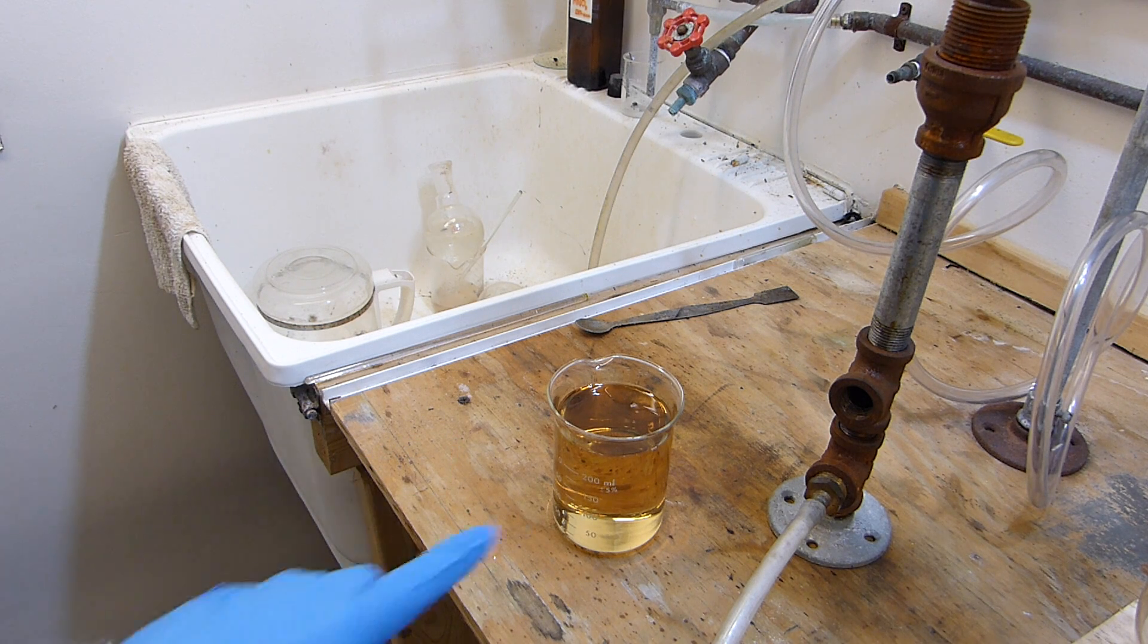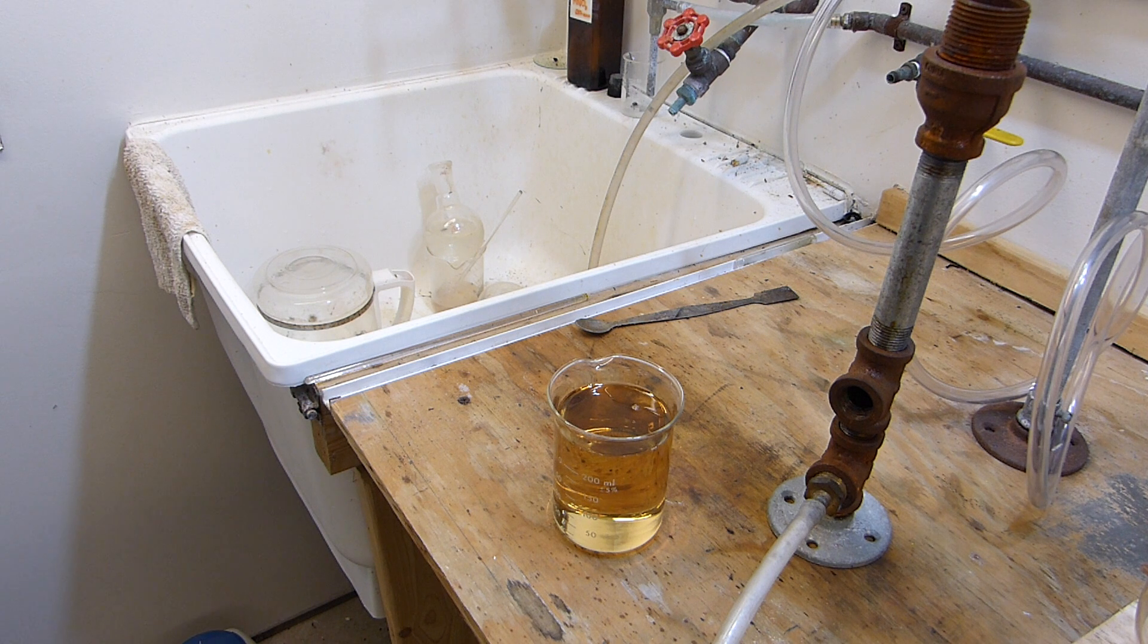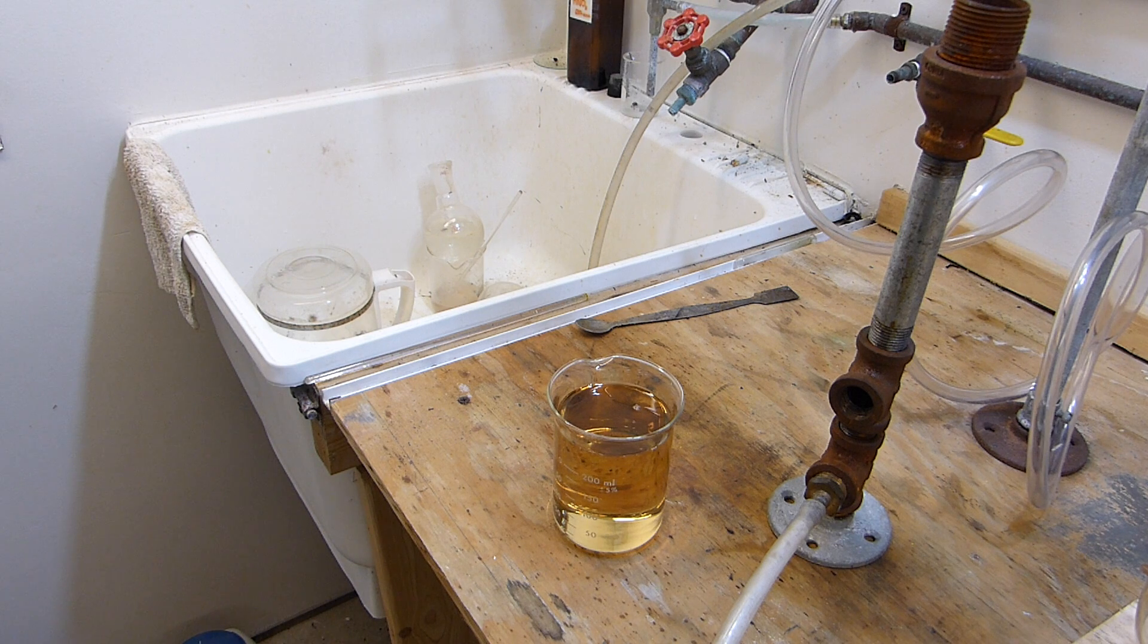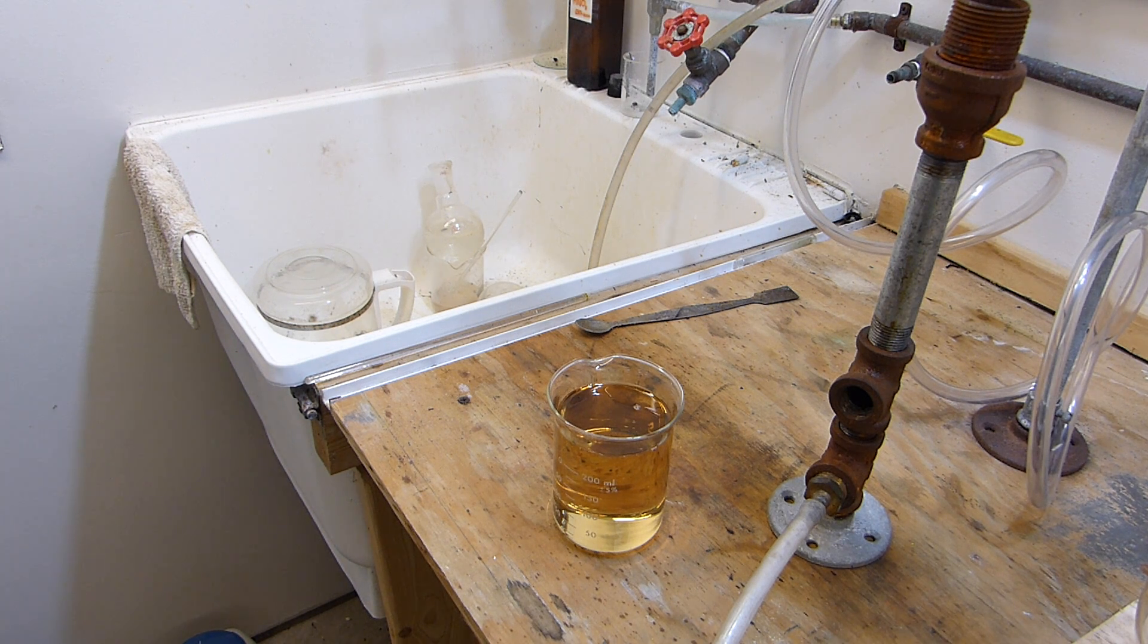I'm going to distill this because I want to remove that coloration which is caused by tiny amounts of organic compounds as well as maybe some metal salts. I haven't actually analyzed it, but distillation guaranteed will remove all of that. So we'll go ahead and charge that into the apparatus.